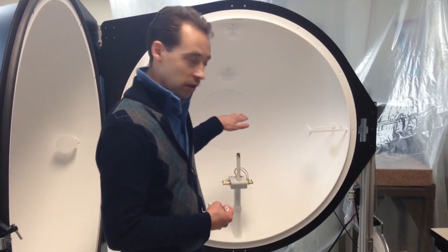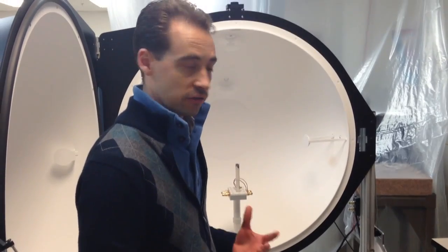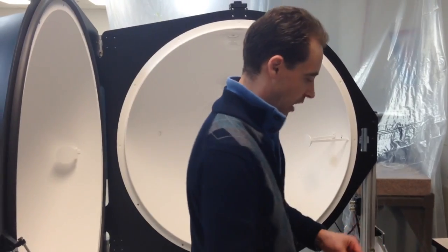It's important to make sure that you get your calibration lamp in the middle because that will give you the best results and the highest accuracy. And you want to be able to avoid some common mistakes.